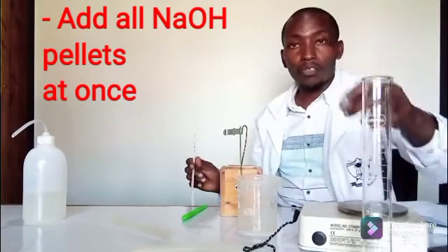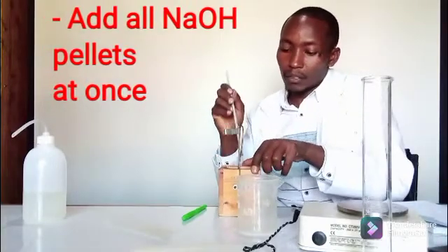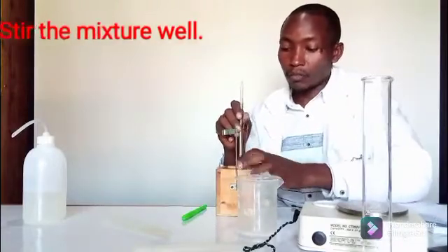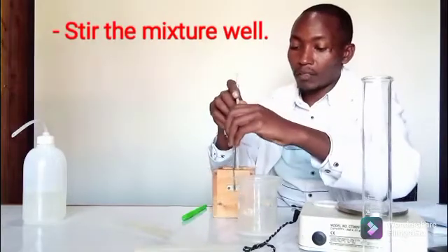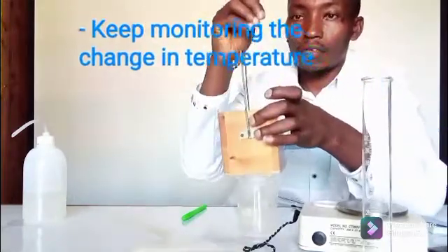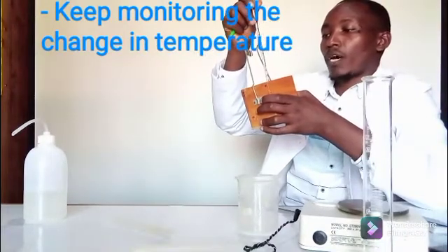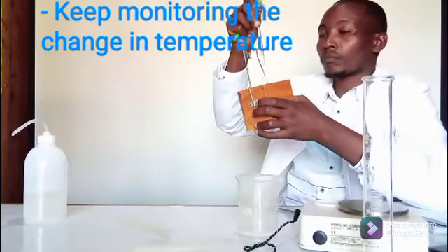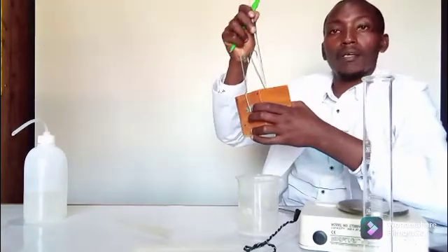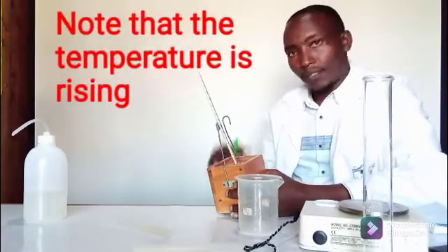I will add the sodium hydroxide at once, then keep stirring — I keep stirring while monitoring the change in temperature. I'll keep monitoring the temperature; the temperature is now at 23°C. I keep monitoring until the temperature will not rise anymore, that is, until the temperature is constant.